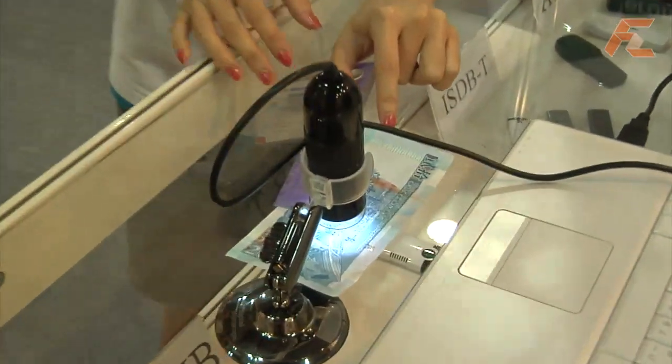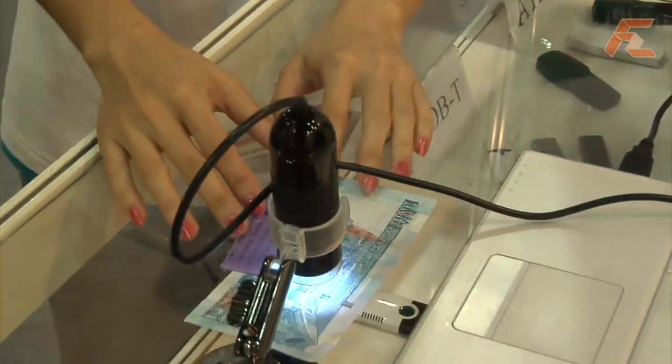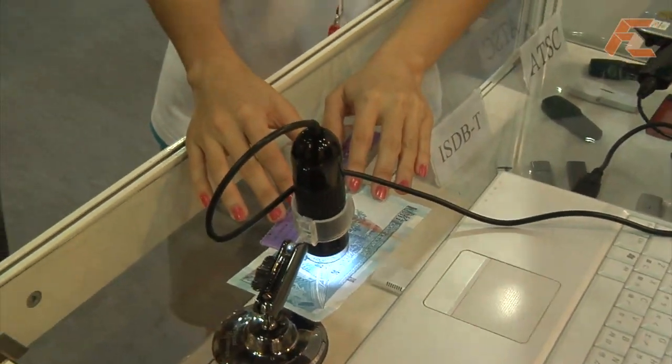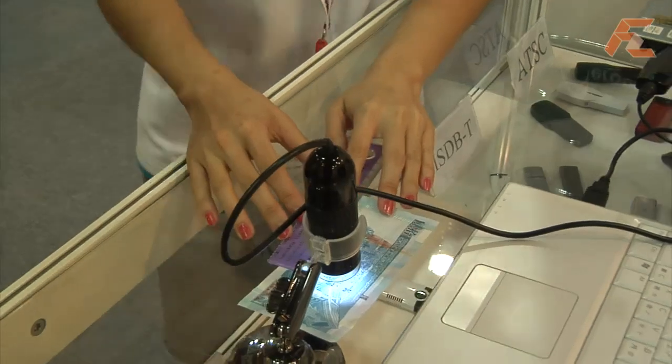What do you have here? What is the name of this product? USB microscope. So what is special about it?